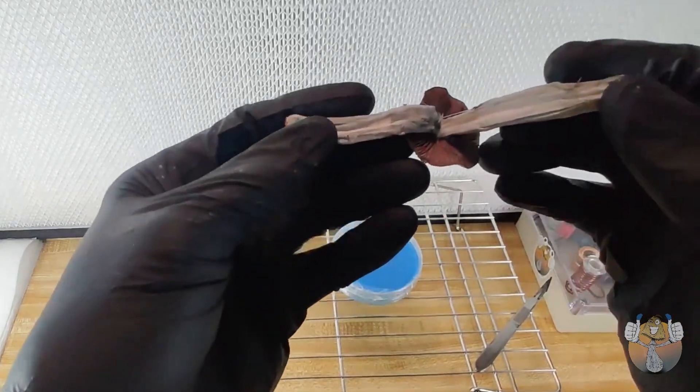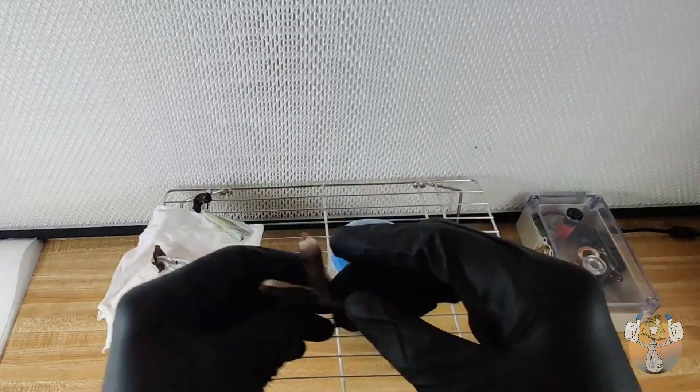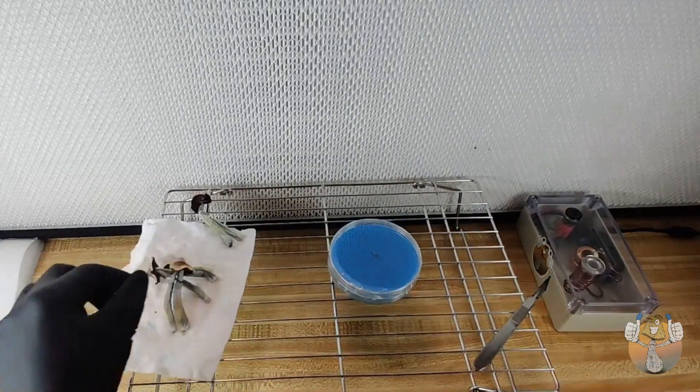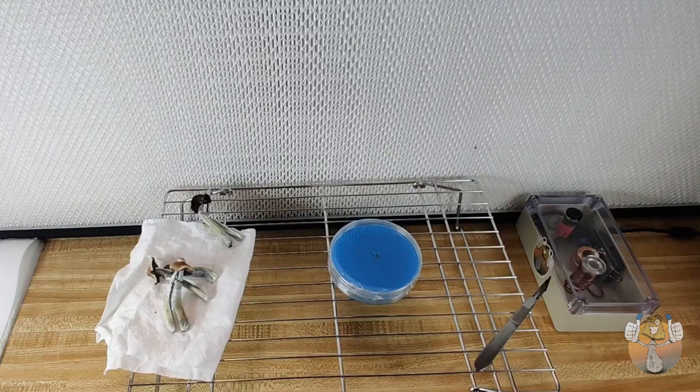So as you see with our cuts, I only used one side of the stipe, and you can use both sides. Just do not place your hands on the part that you're going to be cutting out. And that is all folks. I appreciate y'all for rocking with your boy. Y'all be easy, peace.